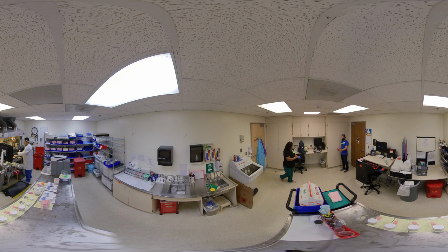Number 1 is, of course, accessioning. And even though this is a very important step, for now, you should just know that accessioning generates a number specific to that patient's sample. Now let's take a look at the second area called grossing.